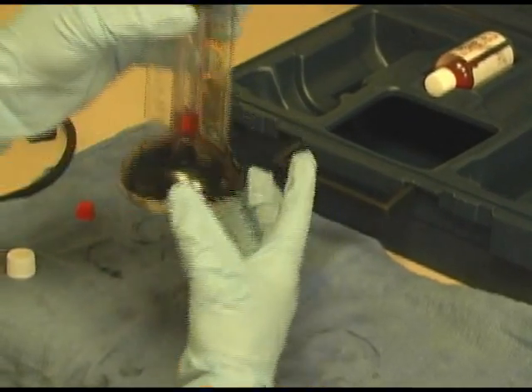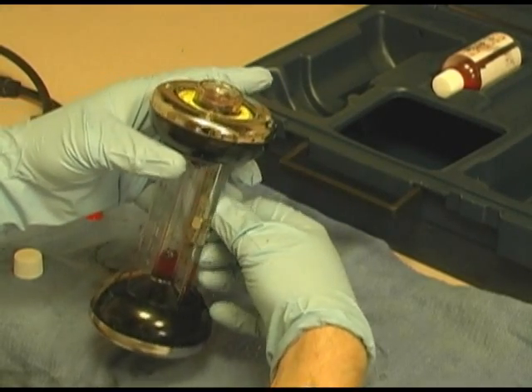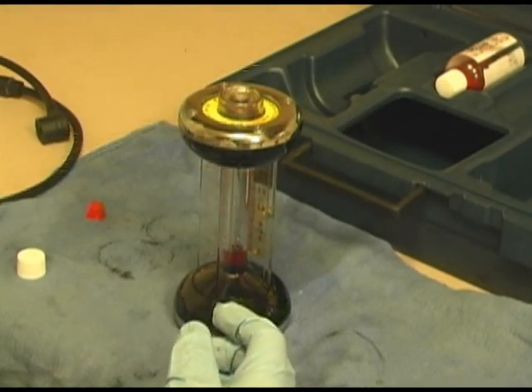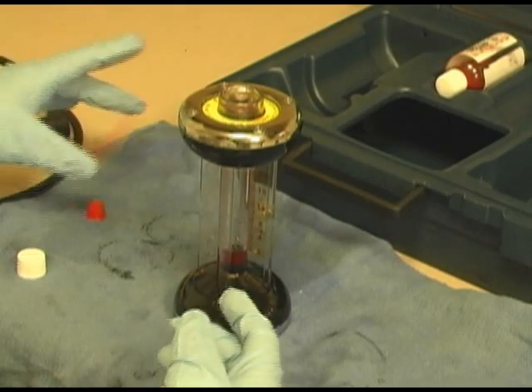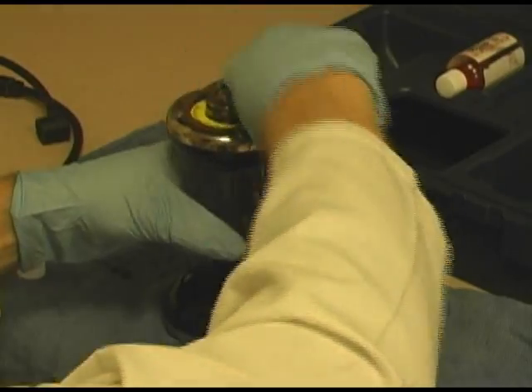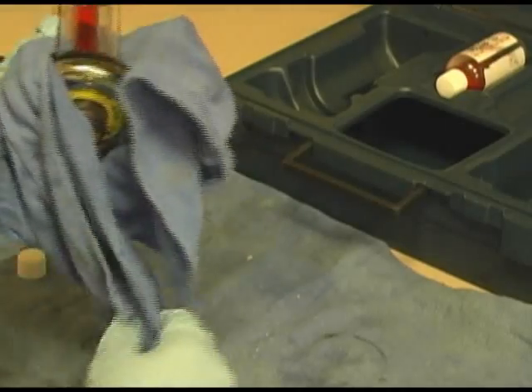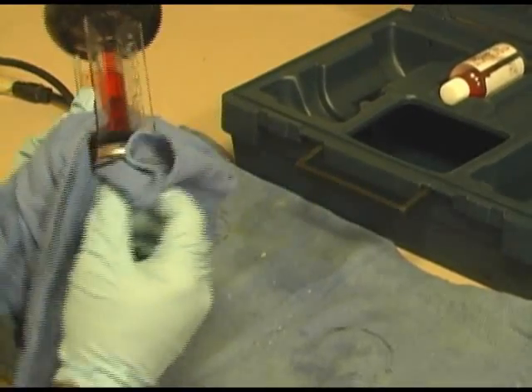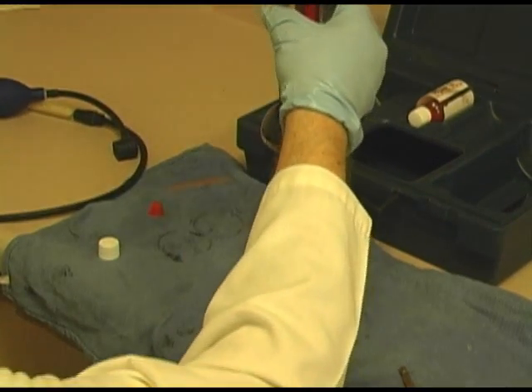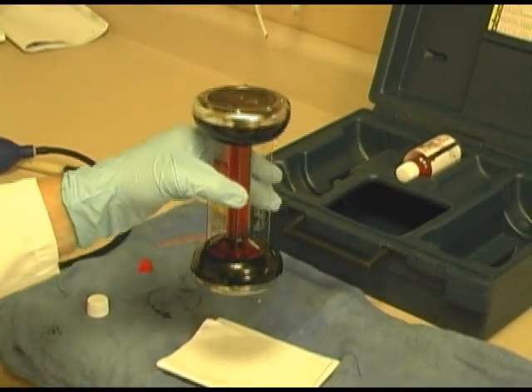Now, I'm going to clean this up a little simply by taping my zero right here. Now again, if you wanted to replace this, feel free. I personally don't see the need, it's just a piece of plastic. Let's clean off some of this Fyrite solution that's dripped down here. I'm going to tip it up a little. And the check that I'm going to make now is, we're going to use a white piece of paper here, to see that I get no drips from it. I should not get any drips.